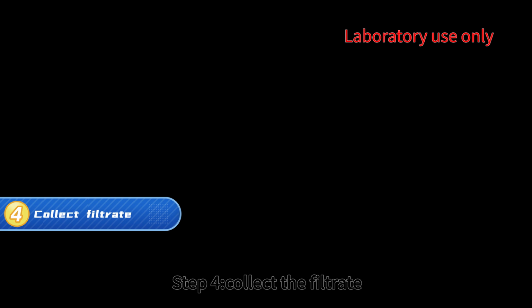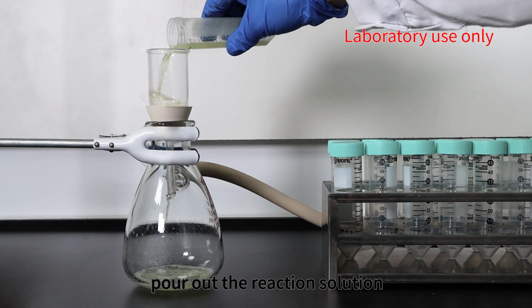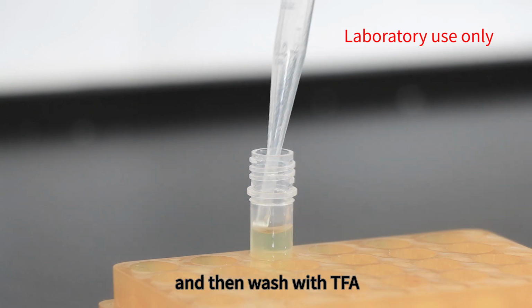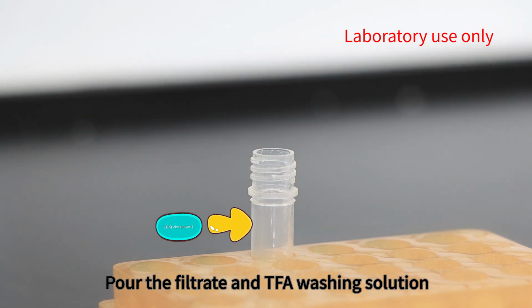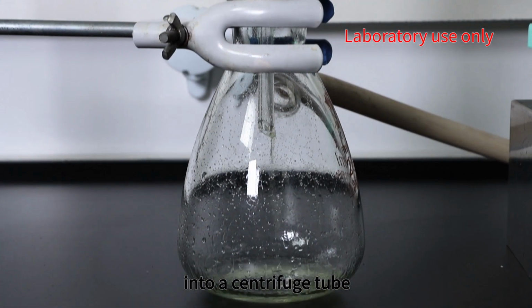Step 4. Collect the filtrate. After the cracking is completed, pour out the reaction solution. Filter to remove the resin, and then wash with TFA. Pour the filtrate and TFA washing solution into a centrifuge tube.